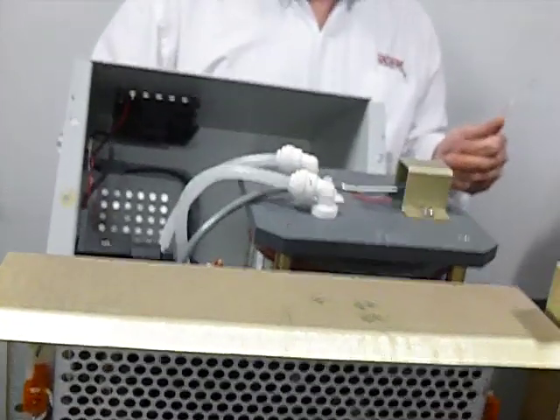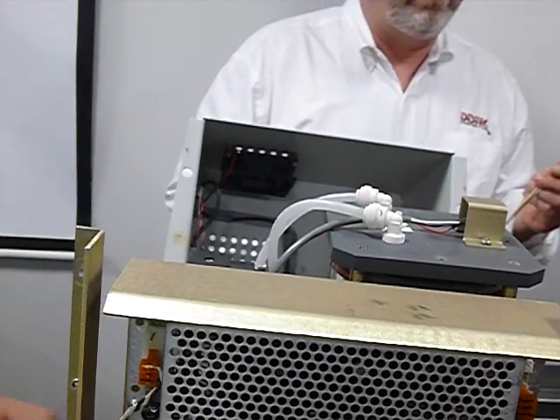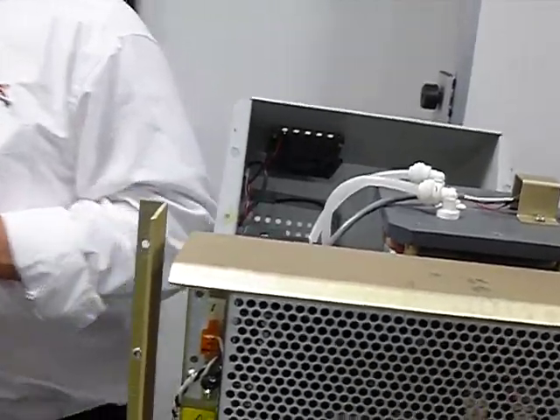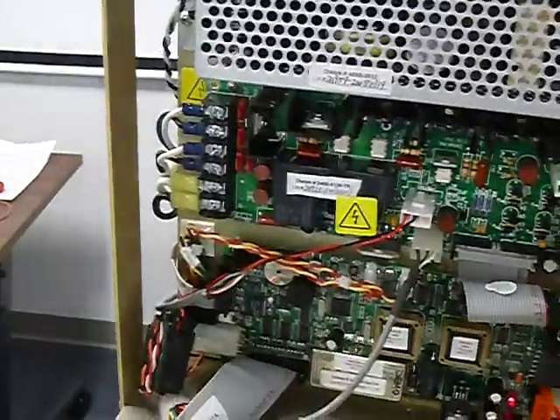So, everybody know how to check to see if a heater is good? Resistance. All right, what should the resistance be? About 17 ohms, all right? So you get your multimeter out. If it is open, it's open. And if it's short, the sensor short should be kiloohms, something like 30 kiloohms.